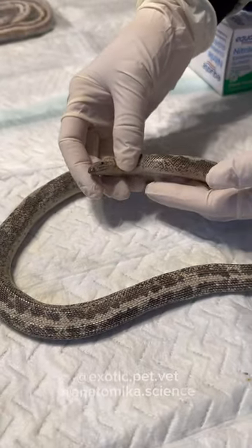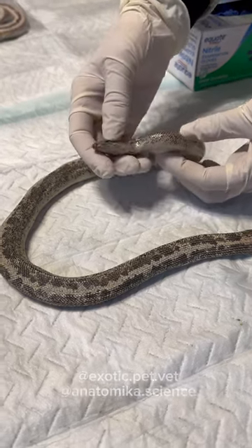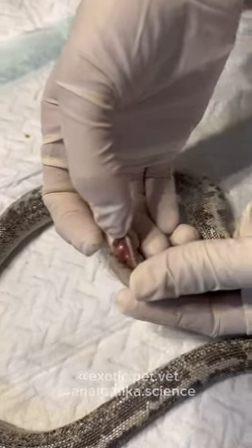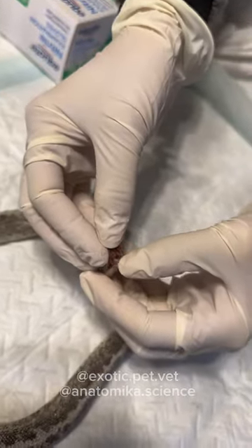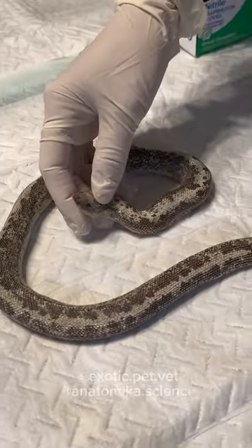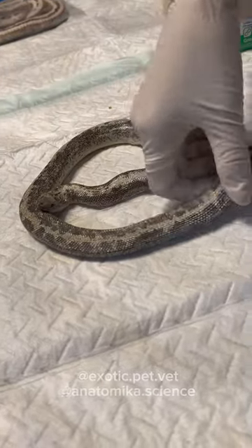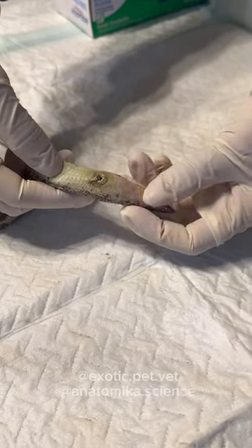What I usually do is start by observing the outside of the animal. What do the eyes look like? Are they sunken? Is there any substrate in the mouth? This one doesn't have any, but his mouth is a little bit mucousy. A lot of times when animals die, they'll have agonal motions where they'll just start rolling around, and sometimes you see snakes or lizards with mouths full of substrate and wood chips from that. And you'll notice there's a large swelling right here — looks like the scent glands, but we'll see.